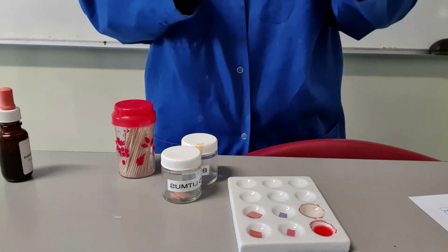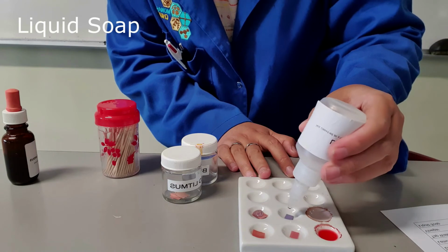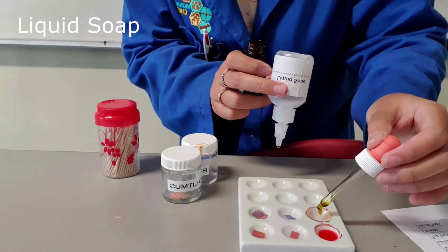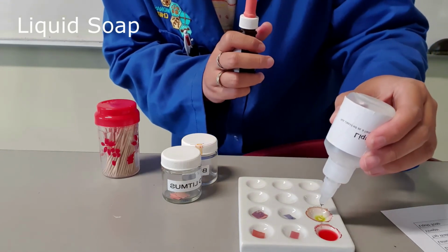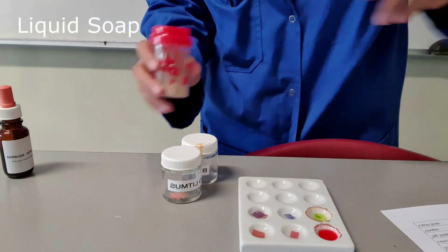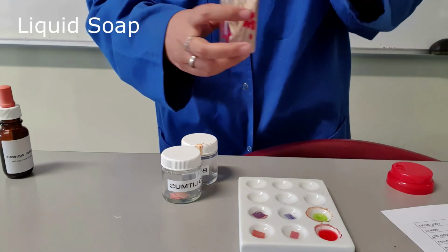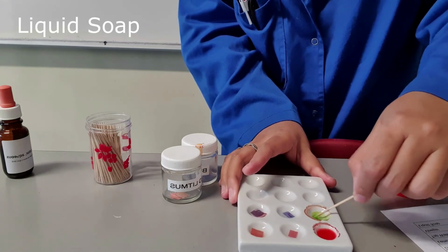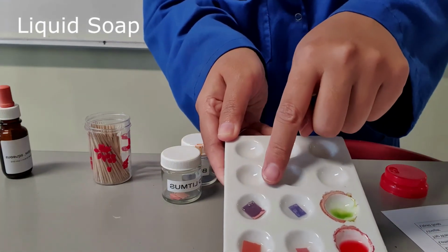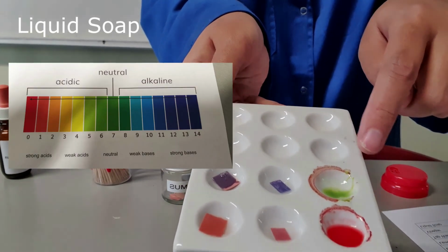And the last one we are going to be testing is the liquid soap. So liquid soap with red litmus paper, blue litmus paper, and in universal indicator. I will need to use a toothpick for this test because the liquid soap itself is quite thick. So red litmus paper with liquid soap, blue litmus paper with liquid soap, and universal indicator with liquid soap.